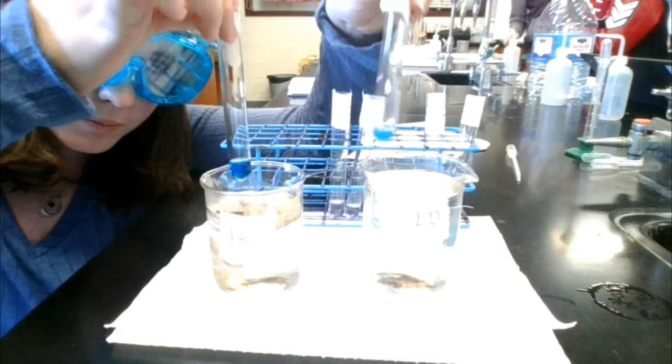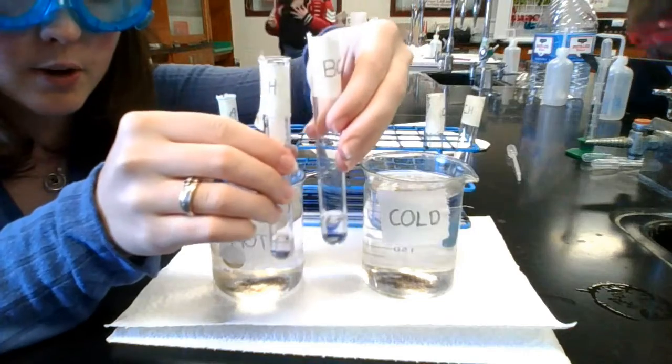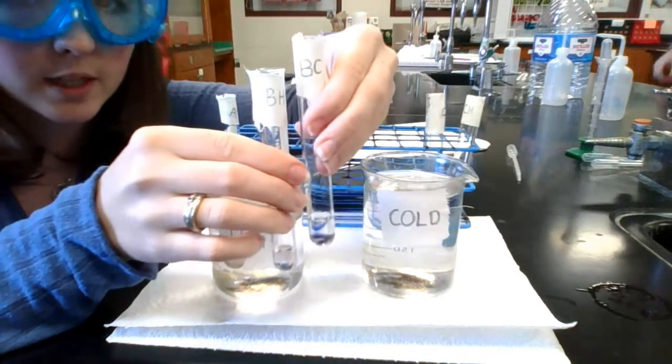Now, here, there is such a superfluous amount of the calcium chloride in solution that it's really hard for it to go back to that hydrate form of cobalt that's red, but it still is revealed to be occurring here with the reduction in color from the left to the right one. So now we are going to look at our B test tubes.